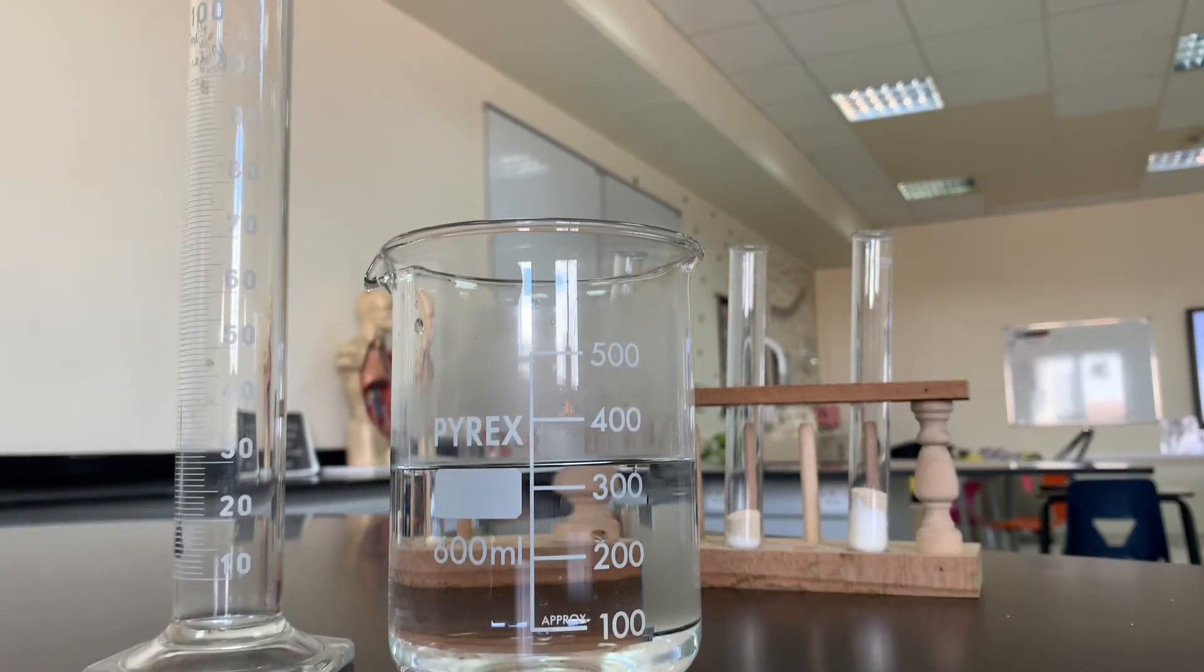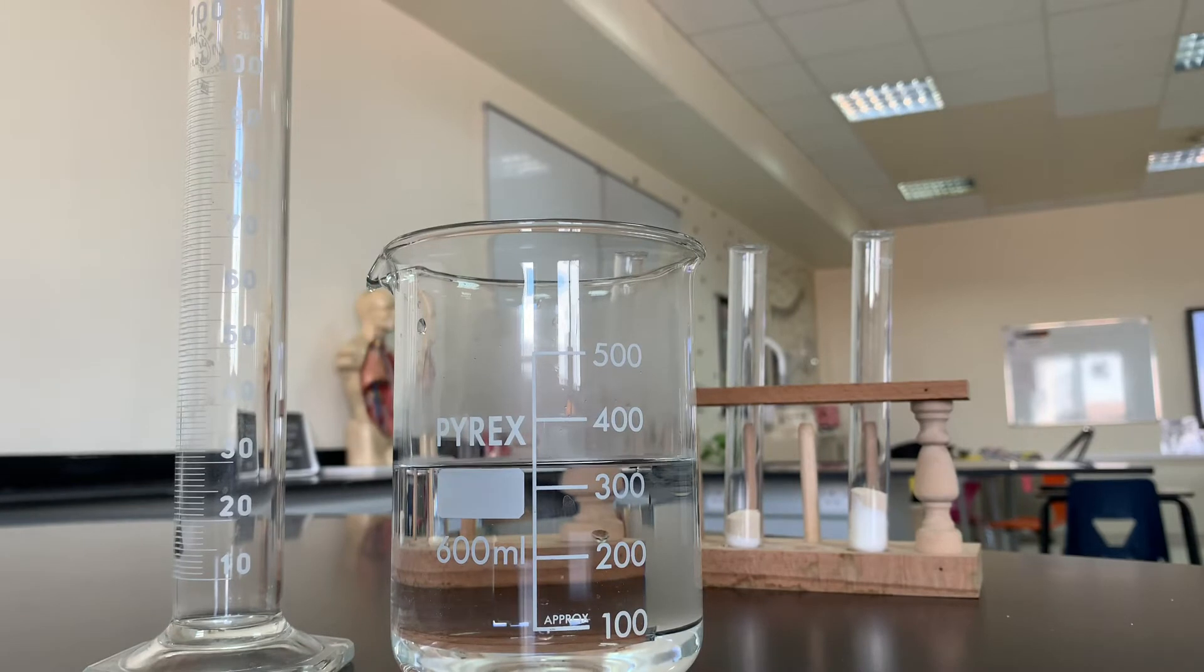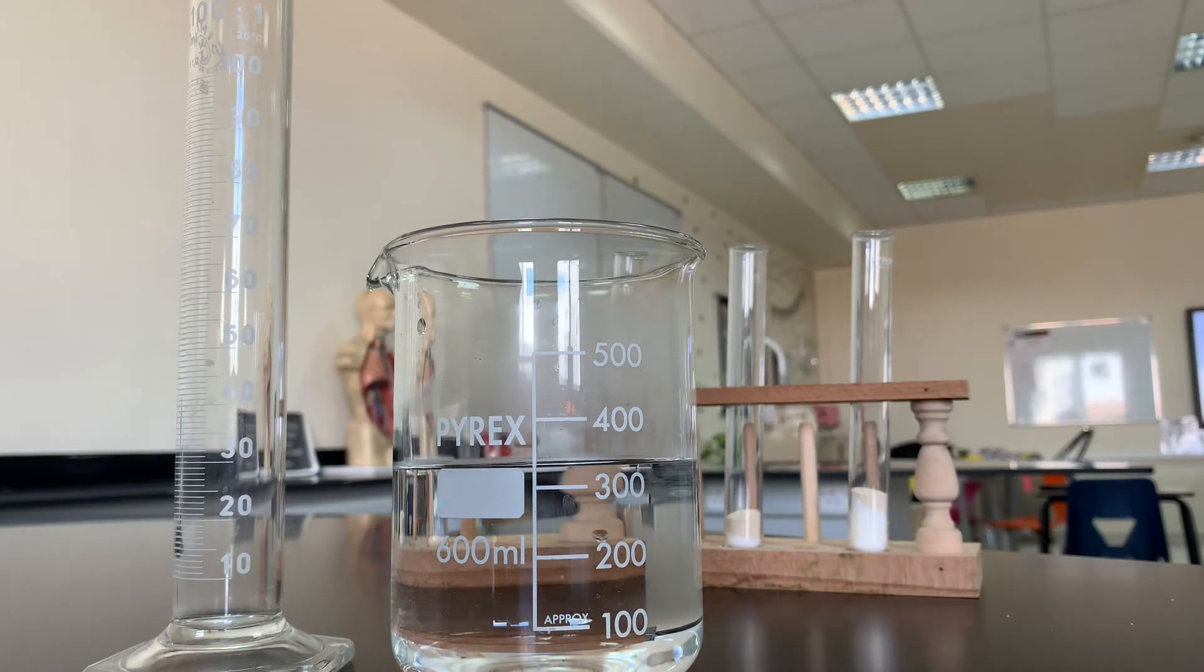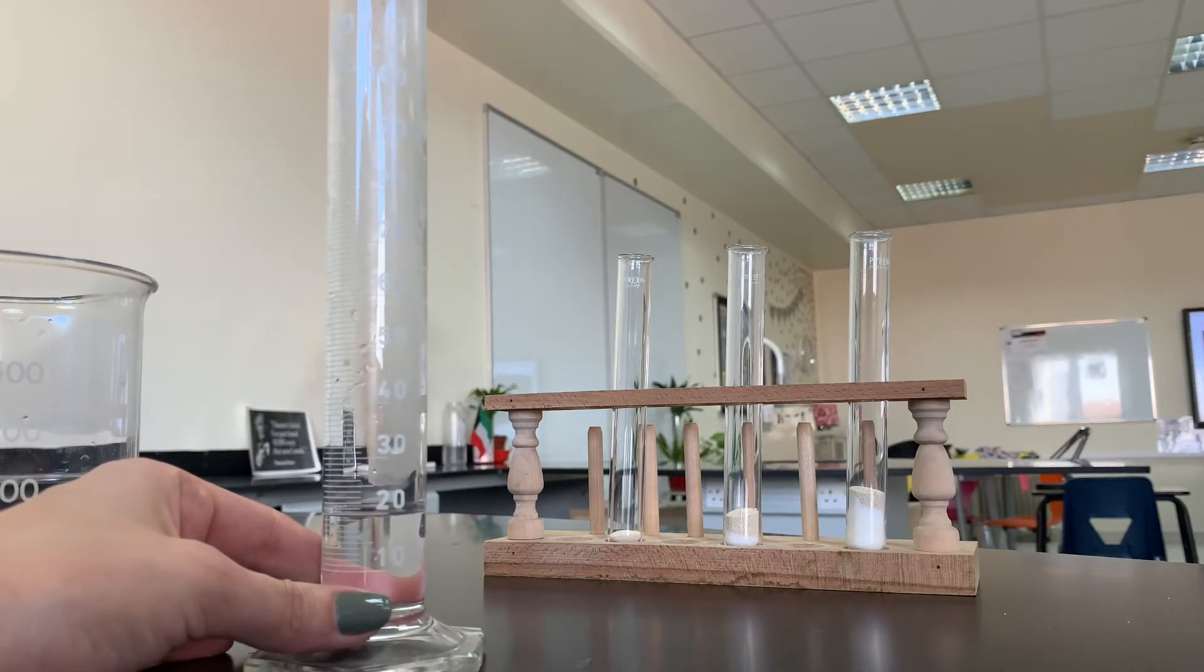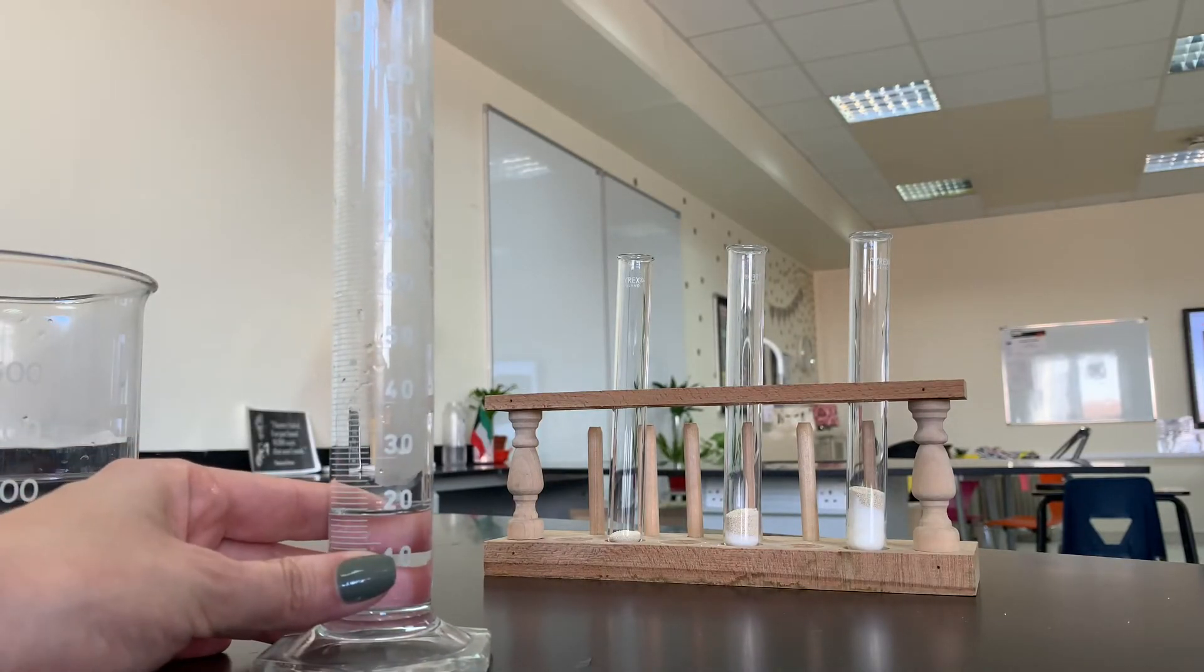It's important that the water is warm and not cold in order to speed up the chemical reaction and help the yeast feed on the sugar faster. I'm going to add 20 milliliters of warm water to each test tube.